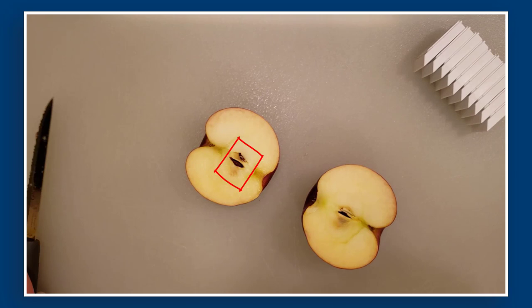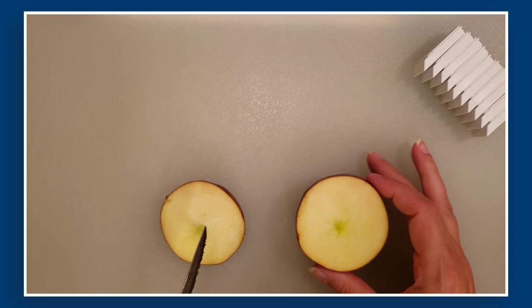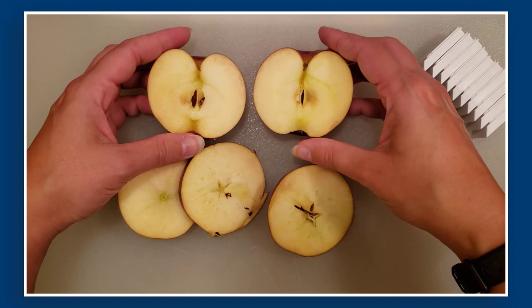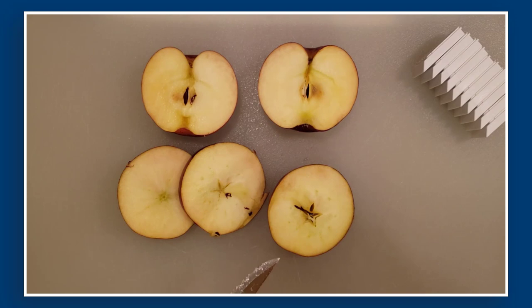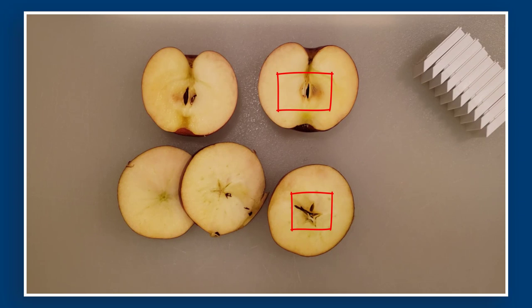I'd also encourage you to think about what happens if you take your tissue section in a different dimension, like this. One of the things to think about when you're taking your histology sections is how you want things to be oriented to each other. The orientation of the tissue is actually pretty important — whether it's this way or this way is going to be what you see on your slide.